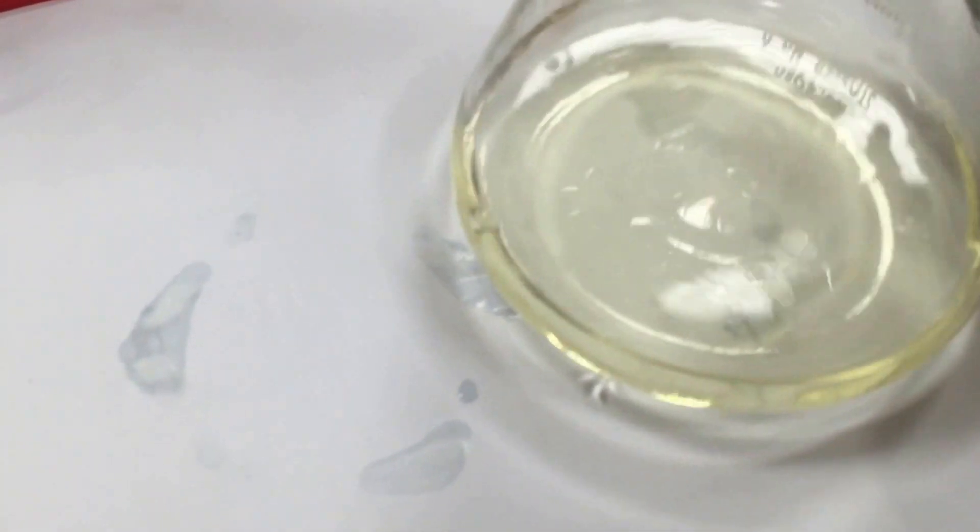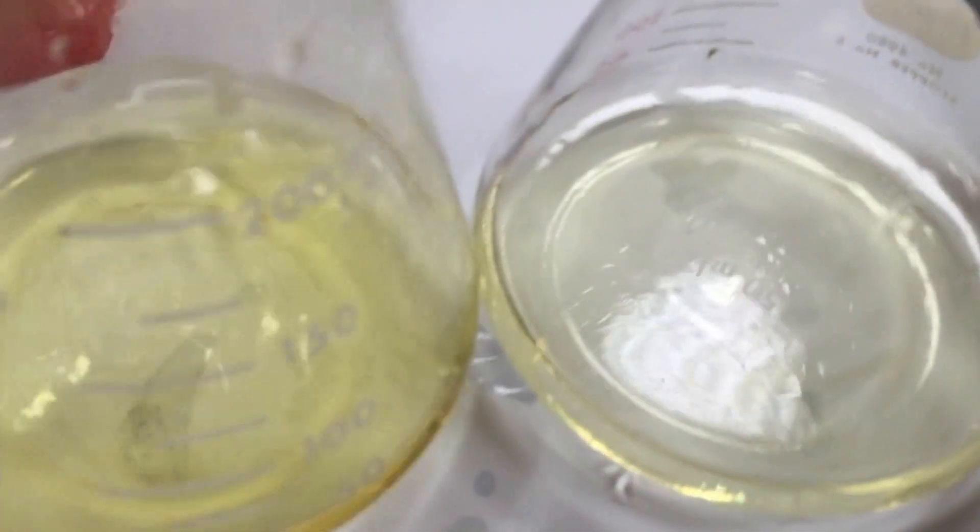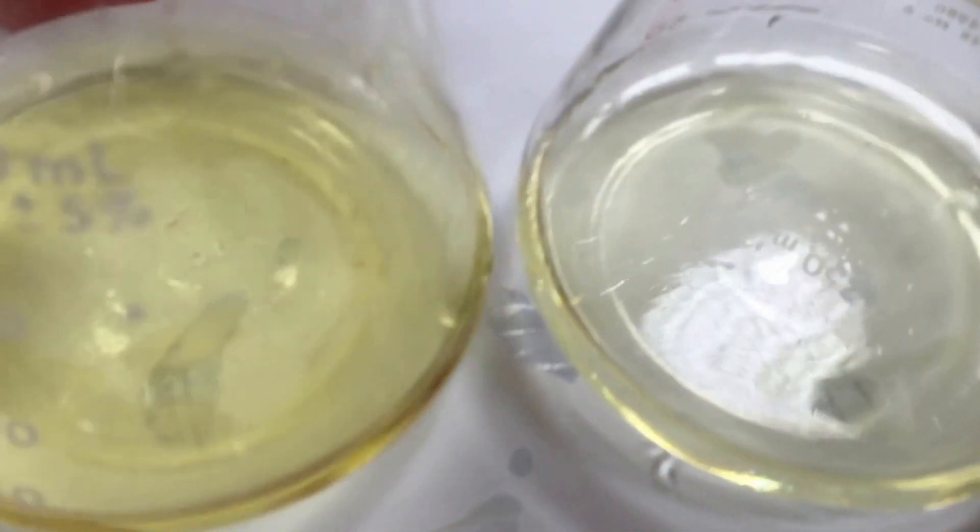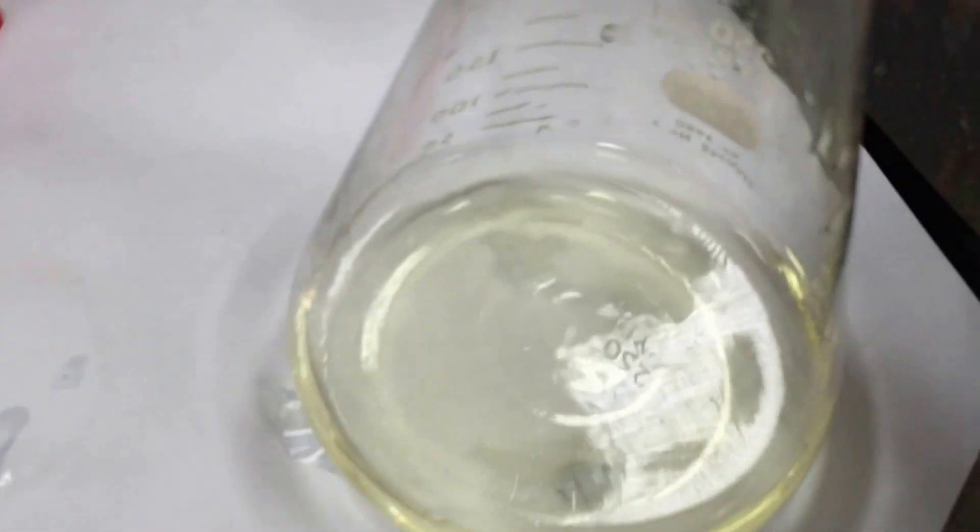That's a lot paler than it was to start with. Just to give you a reference, here's where it started. This is another one I prepared earlier. So it's ready to have the starch indicator added.